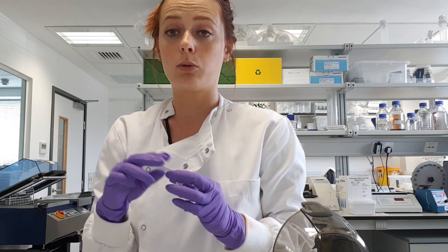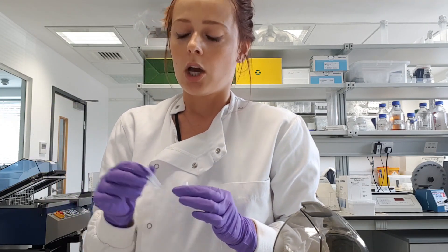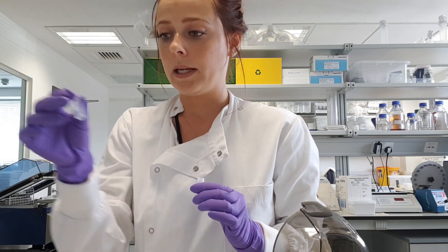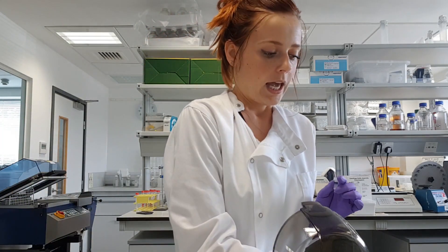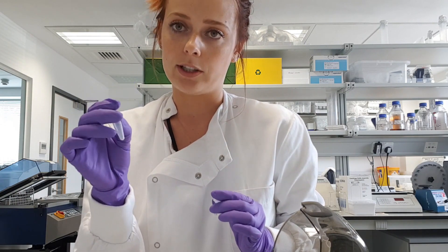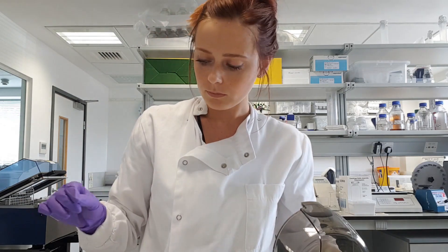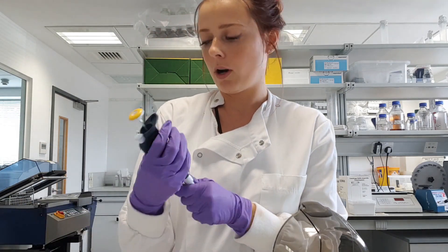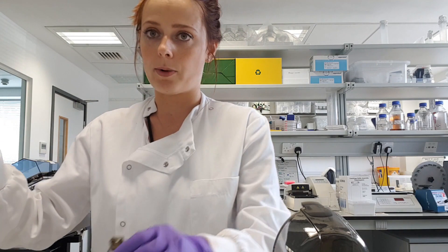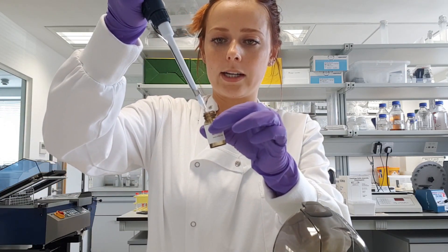All your proteins get retained — along with any remaining PBS from the column — while we proceed to the last centrifugation, again for one minute. At the end, you will have your purified exosomes. I discard the waste tube and place my column into a 1.5 millilitre microcentrifuge tube to collect the purified exosomes. Before the final centrifugation, I add 200 microlitres of PBS on the top of the column one last time.